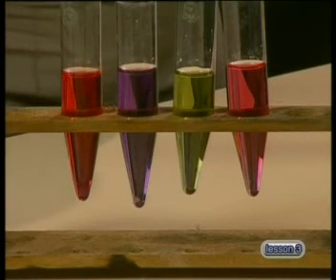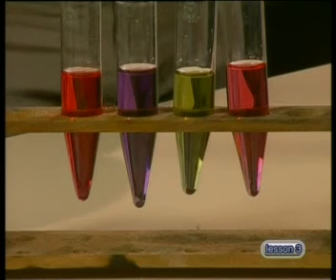Before I say goodbye, let's take one last look at the test tubes to help you compile your table. From this lesson, I'm sure you can see that there are not just three categories — acid, neutral, and bases — but there is a whole range of acidity levels. This pH scale can be measured using electronic instruments too. Here is a pH sensor that we use to check everyday substances. We will use this to check your results at the beginning of the next lesson. Make sure you complete your task because practice makes perfect. Till we meet again, goodbye.